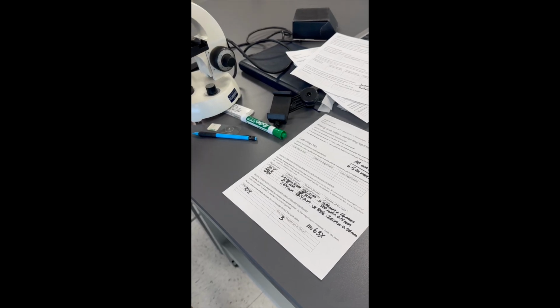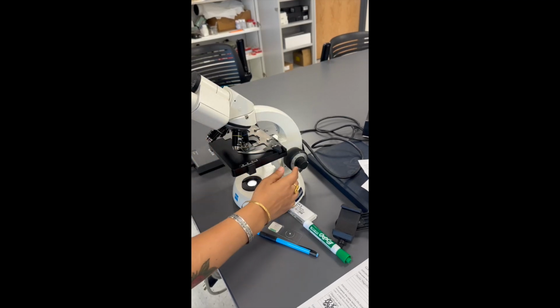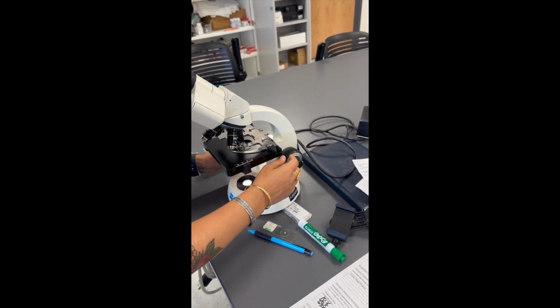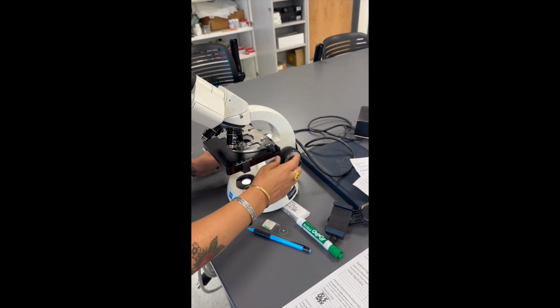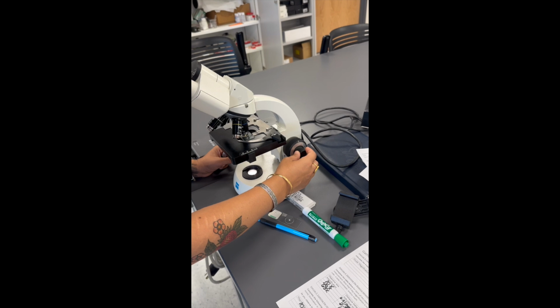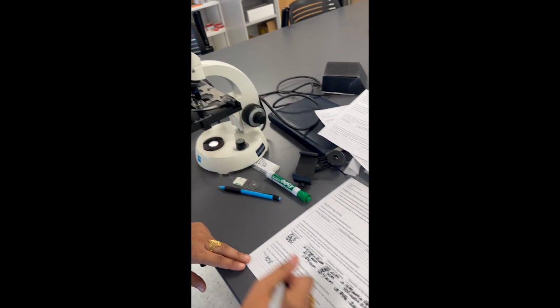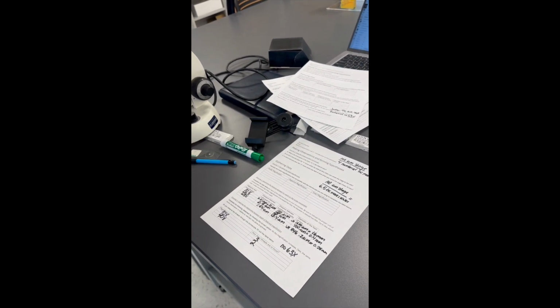If I zoom in or increase my magnification to 40x, now I'm going to have to back off the middle of the thread slide and play with my fine focus to see how many threads are in focus. So I backed off the middle and I'm looking at 2 threads at a time, and I can see that both red and blue are in focus together. Whereas if I look at yellow with that same fine focus, the yellow is now out of focus. So I'm going to go ahead and say that at 40x, 2 of the threads are in focus.